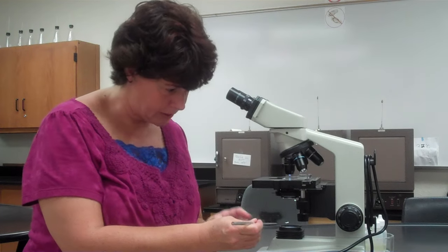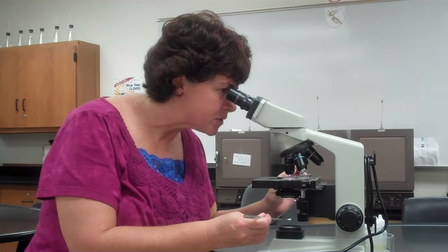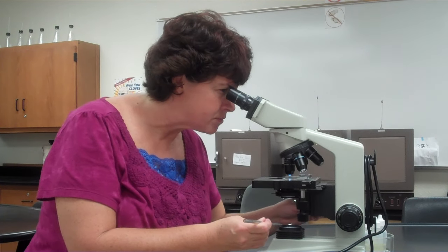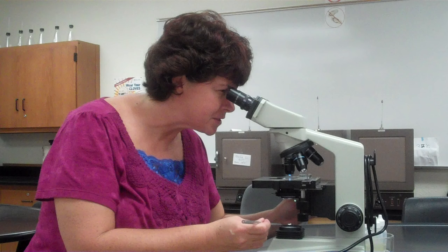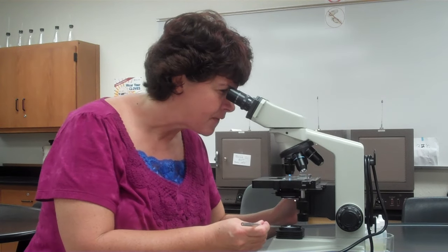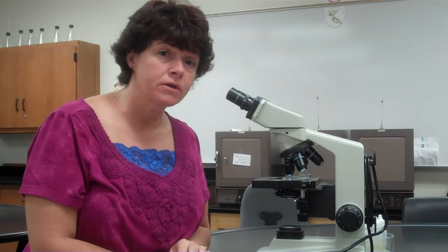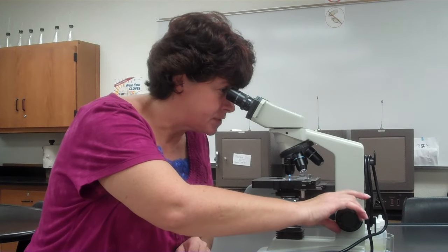To check if your condenser is in the right place, here's a trick: hold your loop over the light source while looking through the microscope and try to focus on the loop. Move the condenser until the loop comes into focus — your specimen will go out of focus, but that's the perfect condenser position. If you do this at the beginning of a lab, you'll have better focusing. It takes just a minute, and if you skip it you might have issues.